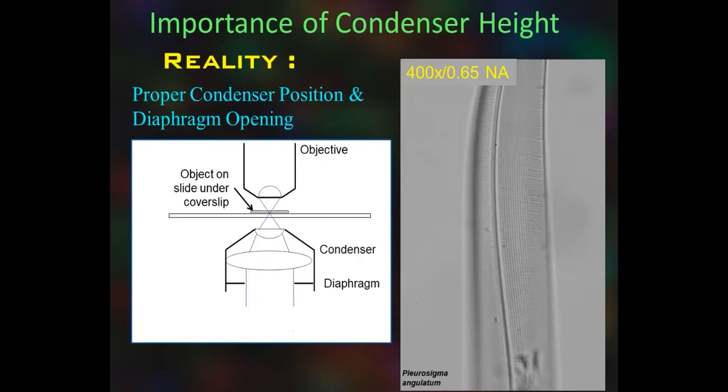In this slide, we see the image on the right. The puncta, or little dots, are clearly visible inside the diatom. The focus of the objective did not change, only the condenser position. The condenser is correctly focused on the specimen, and the condenser diaphragm was not adjusted. Only the position of the condenser relative to the specimen. The blue lines in the diagram on the left show the light focusing on the specimen due to correct placement of the condenser. The light from the specimen then enters into the objective. I'll be showing a quick way to achieve this in just a little bit. In another webinar, we'll cover setting up a microscope in more depth.